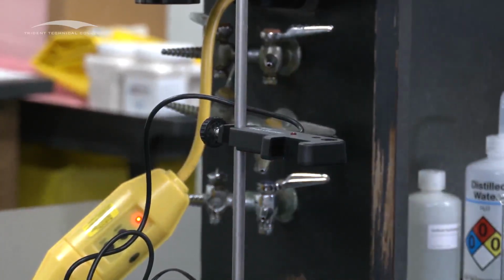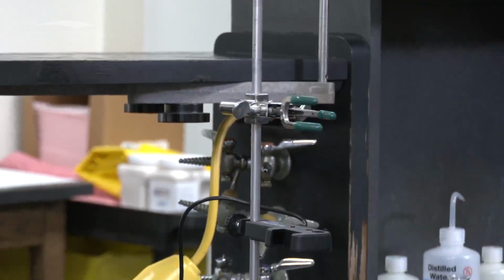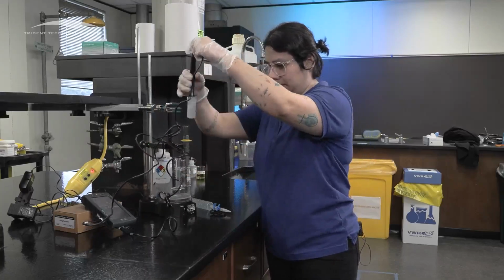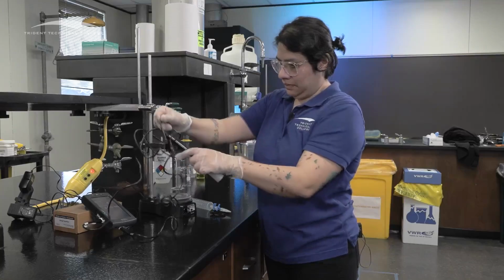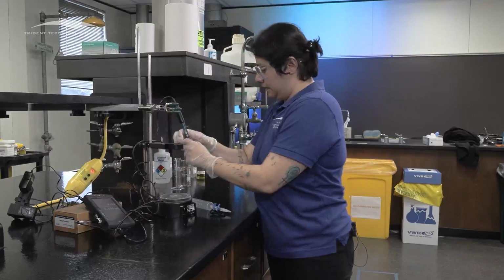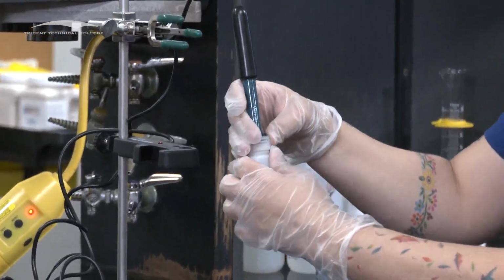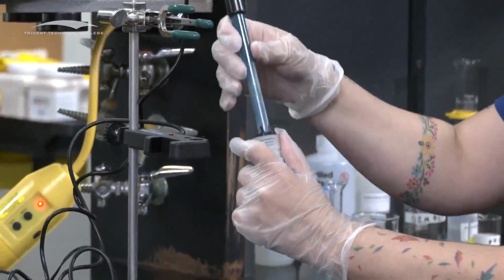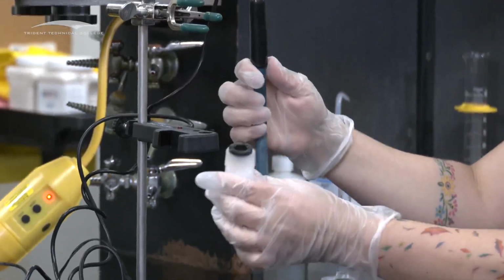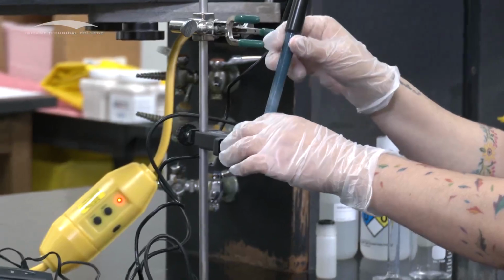And then you wanna set up this one. To decide the height, you're gonna take your pH probe. Don't forget that the easiest way to unplug the pH probe is just to unscrew it, and be careful because it will drop, and then take it out. And then cap it. Don't forget that this is open, so it still will spill if you are not careful. And this goes right here.